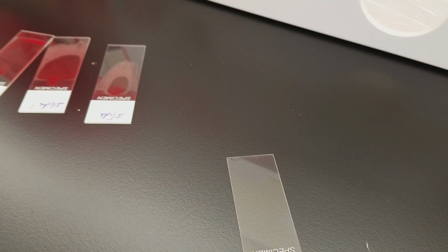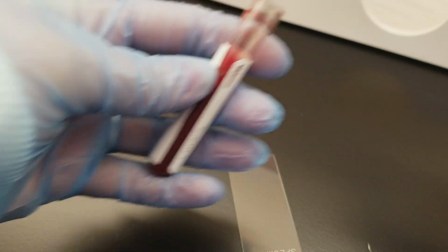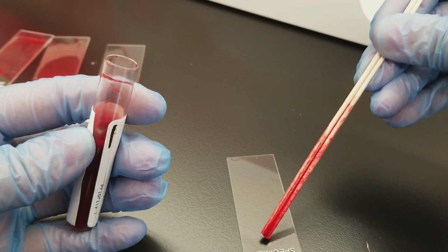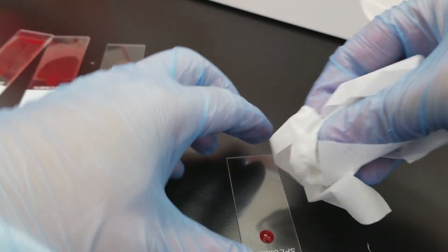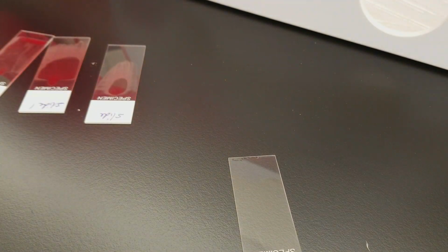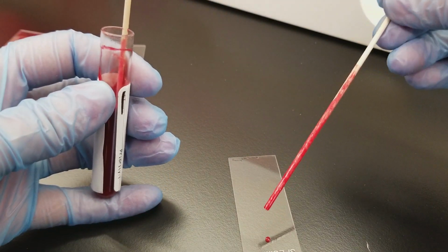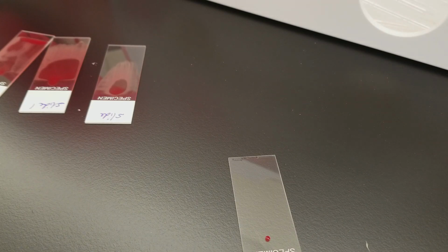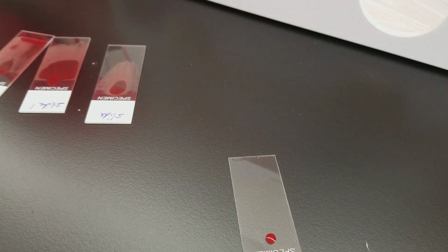So we'll try one more time, and I apologize if I don't get a really good one. You can use a dropper too if you'd like, or even one stick to put. Oh my goodness, that's so big. You can use a dropper or just one stick if you want to try this out. The main thing that I'm pointing out is that we have an idea, this is embarrassing, for using a spreader slide differently. That's the main point we're making here. You don't have to use the sticks.